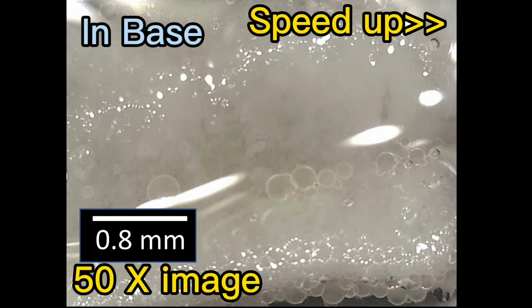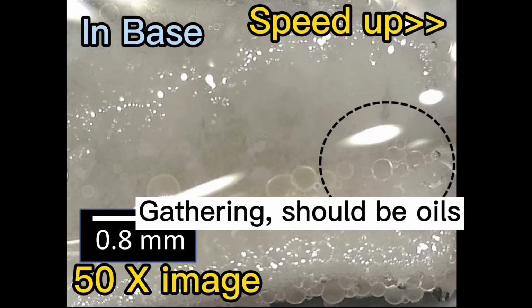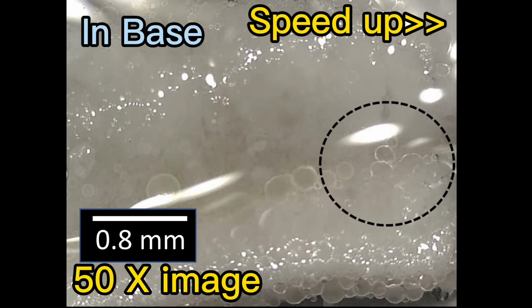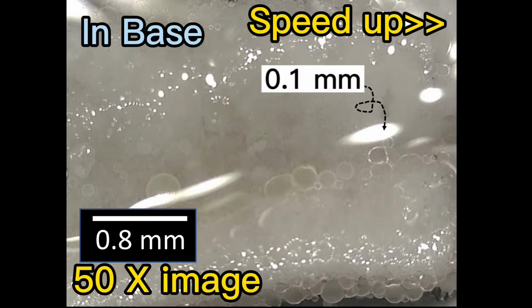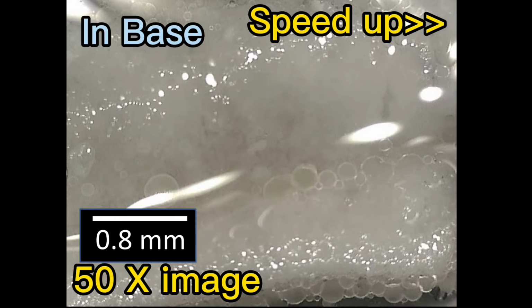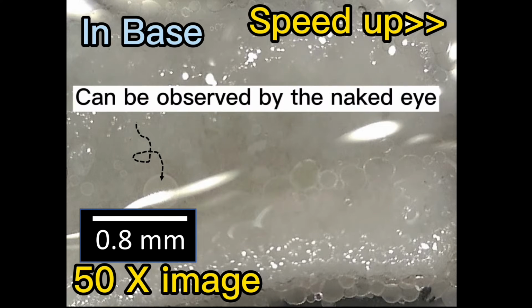Later, when we observed it for a while, we found that these bubbles were oil and they became bigger and bigger. About their size, the small ones are 0.1 millimeters, and the large ones can be close to 0.5 millimeters, which could be observed by the naked eye without using the microscope.